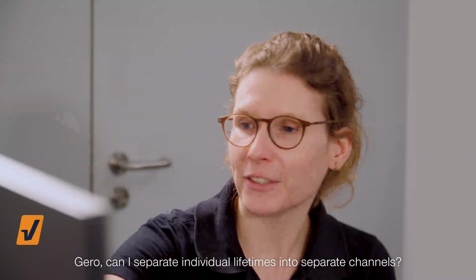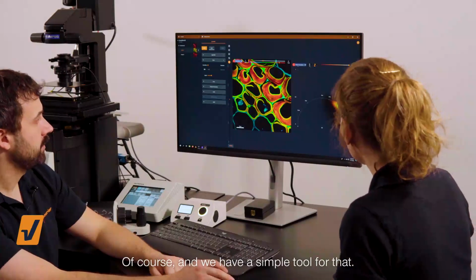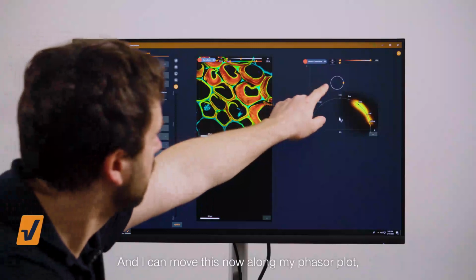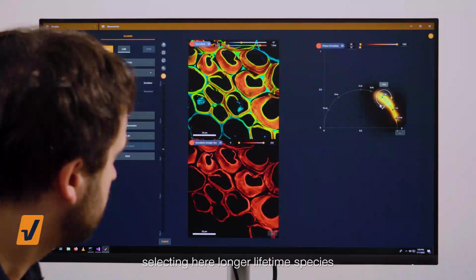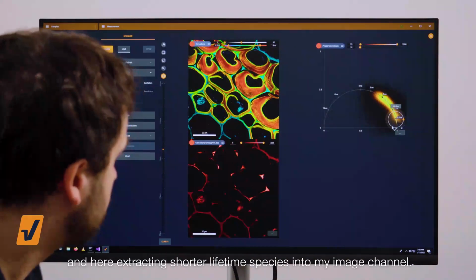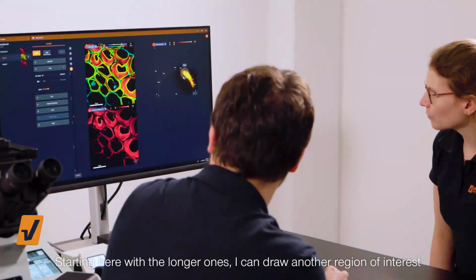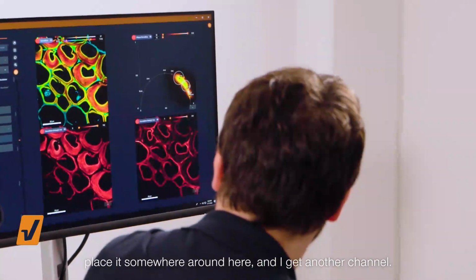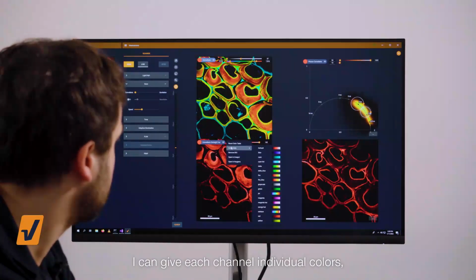Gero, can I separate individual lifetimes into separate channels? Of course, and we have a simple tool for that. Basically, you just draw a region of interest, a circular one here. And I can move this now along my phasor plot, selecting here longer lifetime species, and here extracting shorter lifetime species into my image channel. Starting here with the longer ones, I can draw another region of interest, place it somewhere around here, and I get another channel. I can give each channel individual colors.